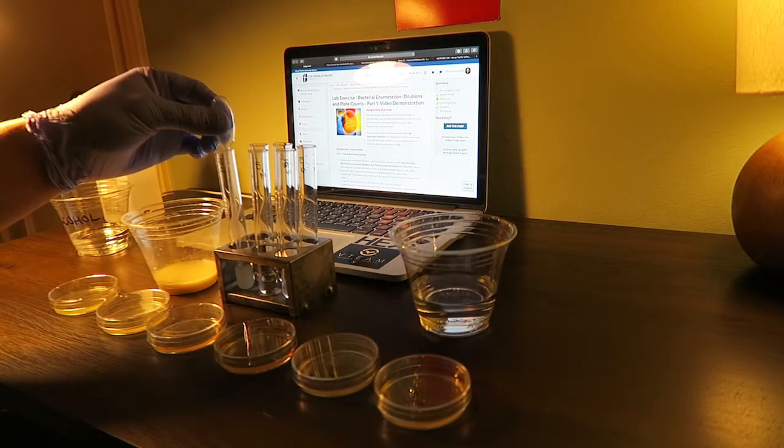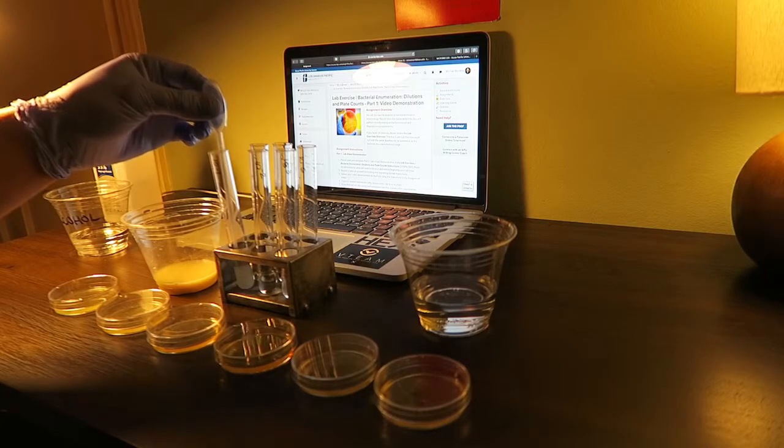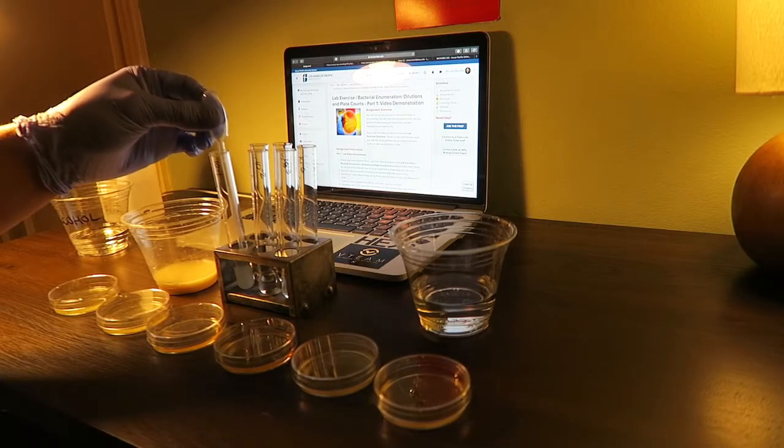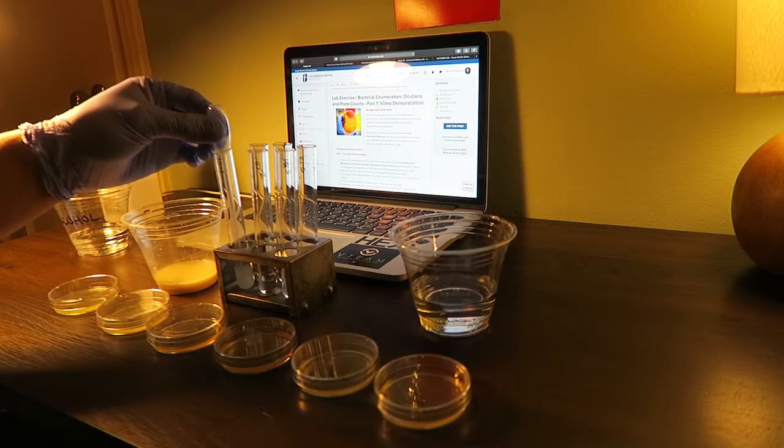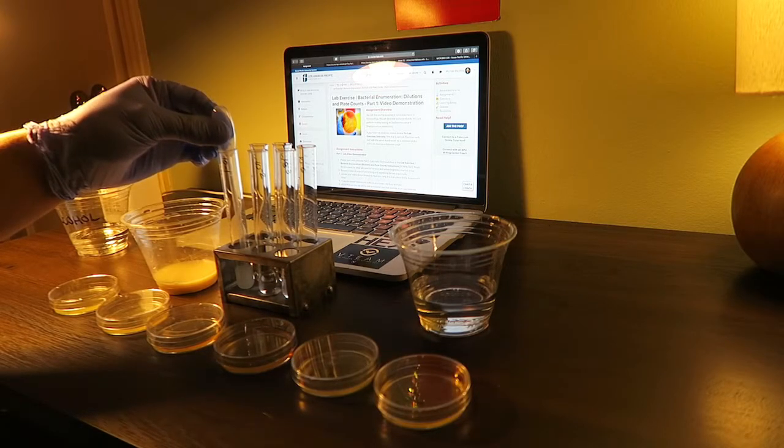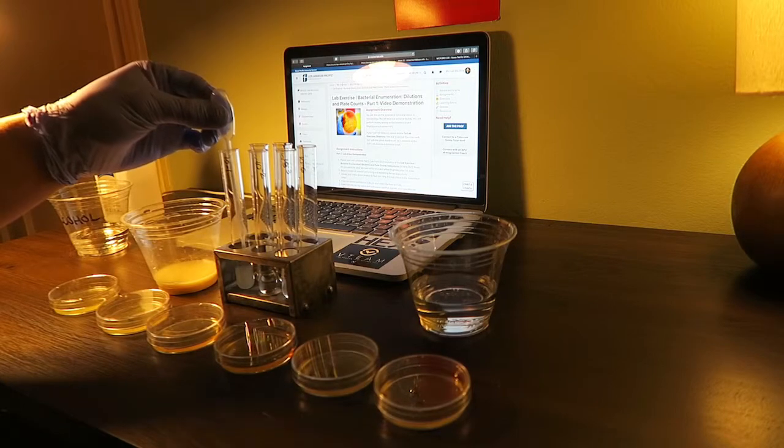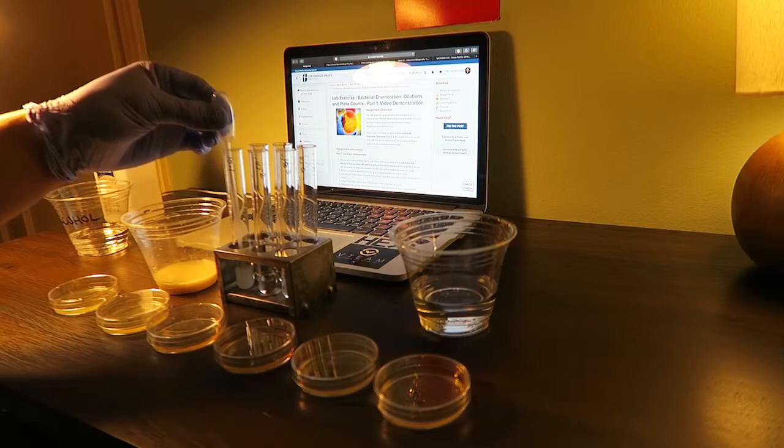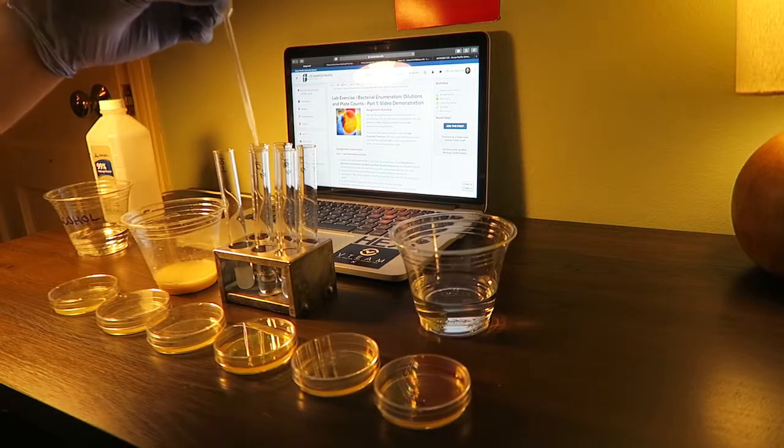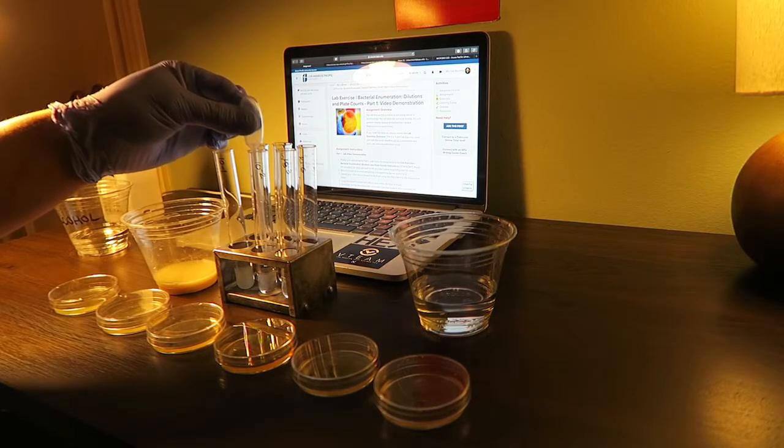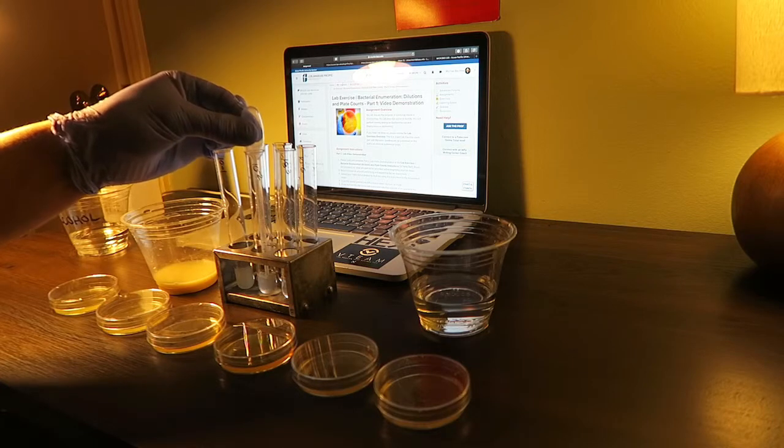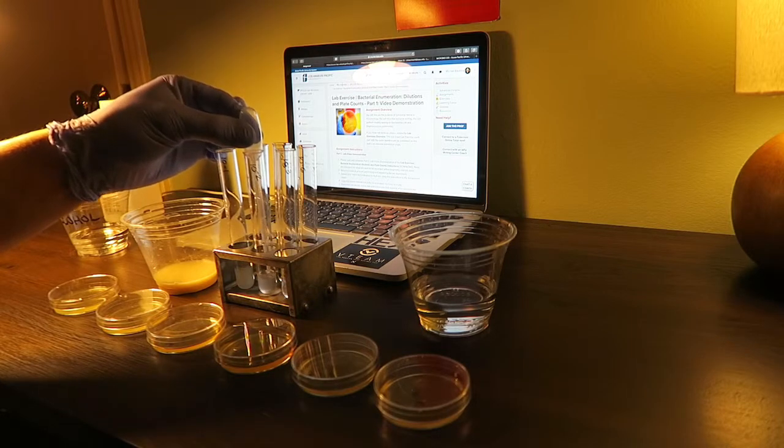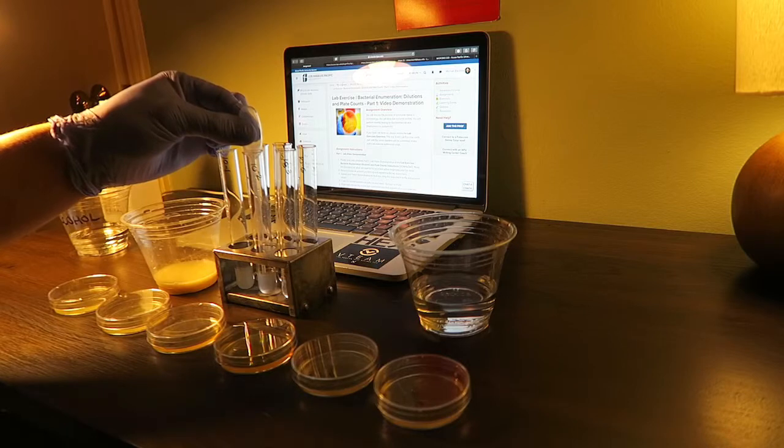Then I'll pipette 0.25 ml from tube one and put it into tube two. I'm going to swirl this, making sure that all the organisms are transferred from the pipette.